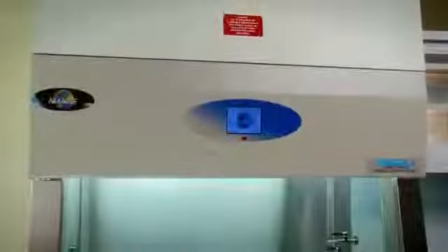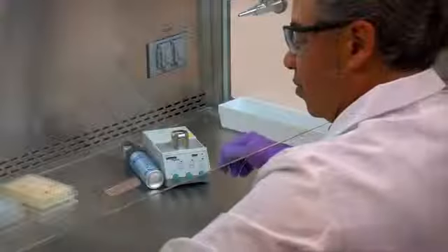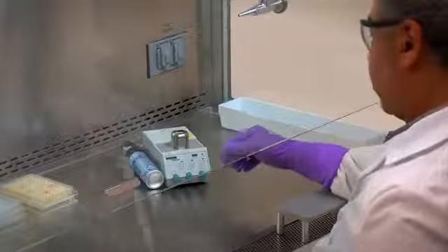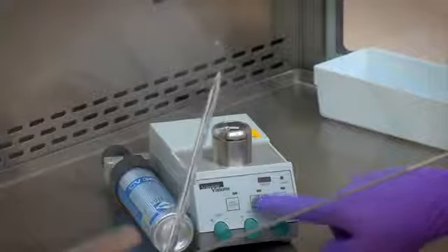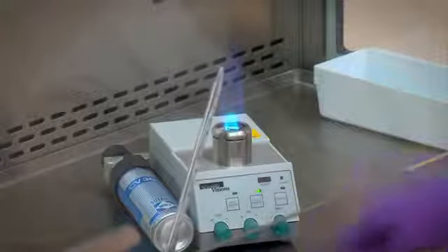In almost all cases, open flames are not required in the near-microbe-free environment of a biological safety cabinet. On an open bench, flaming the neck of a culture vessel will create an upward air current, which prevents microorganisms from falling into the tube or flask.